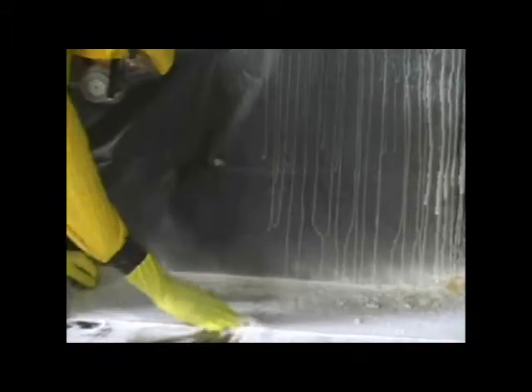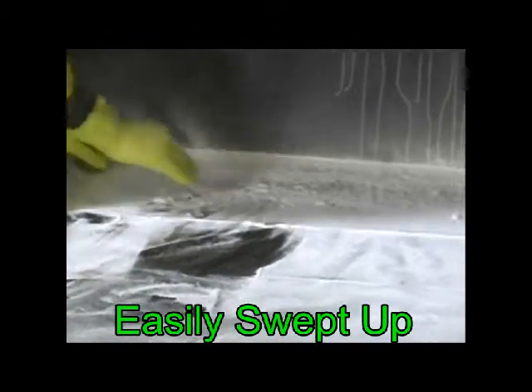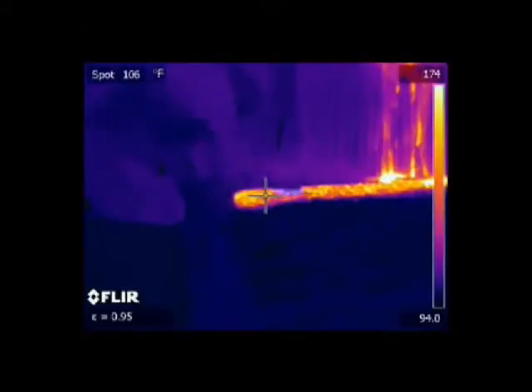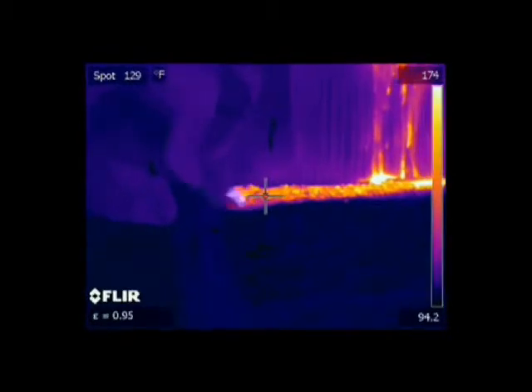Hand wiping the floor shows that the unused encapsulator may be easily swept up to be used again. The encapsulated sulfuric acid now can be safely handled, shoveled, or swept up. Check the temperatures depicted by the FLIR camera. The highest temperature is now 174 degrees Fahrenheit. The lowest temperature is 94.2 degrees Fahrenheit, and the spot temperature is 129 degrees Fahrenheit. If you went by color only and did not look at the temperature scale, you would think the temperatures would be much higher.